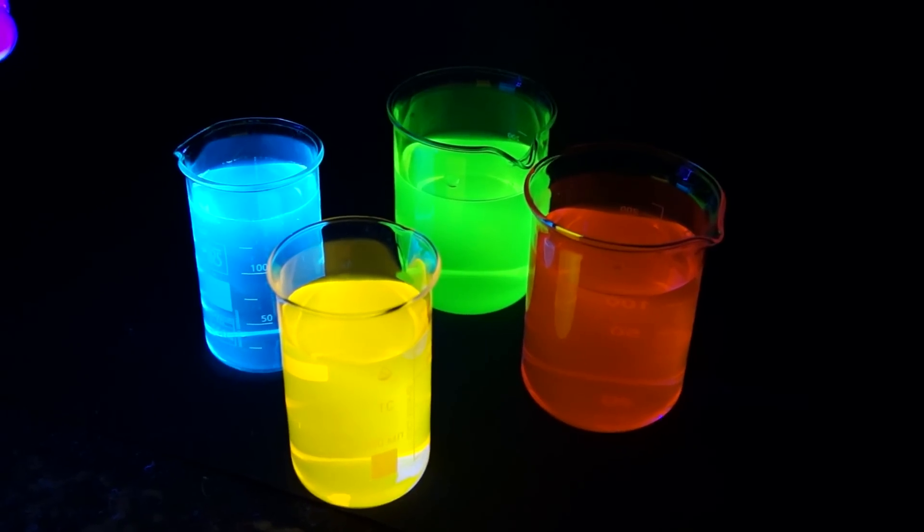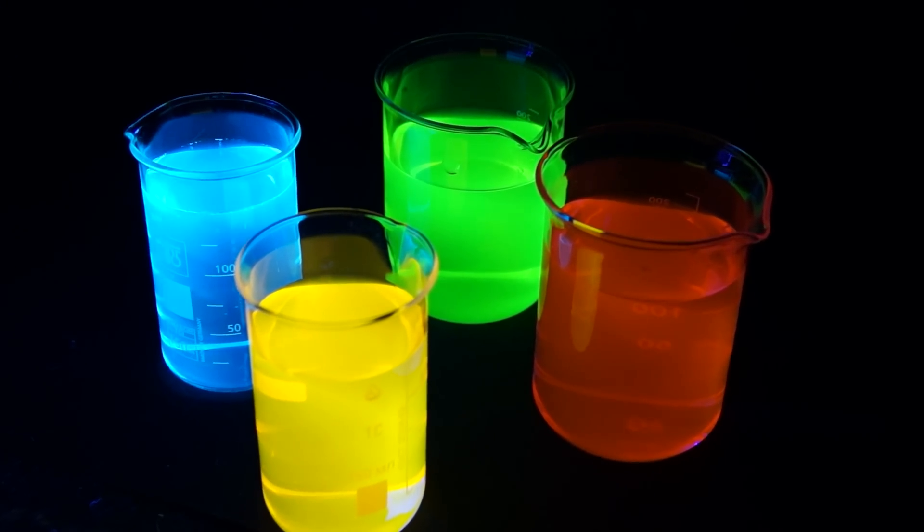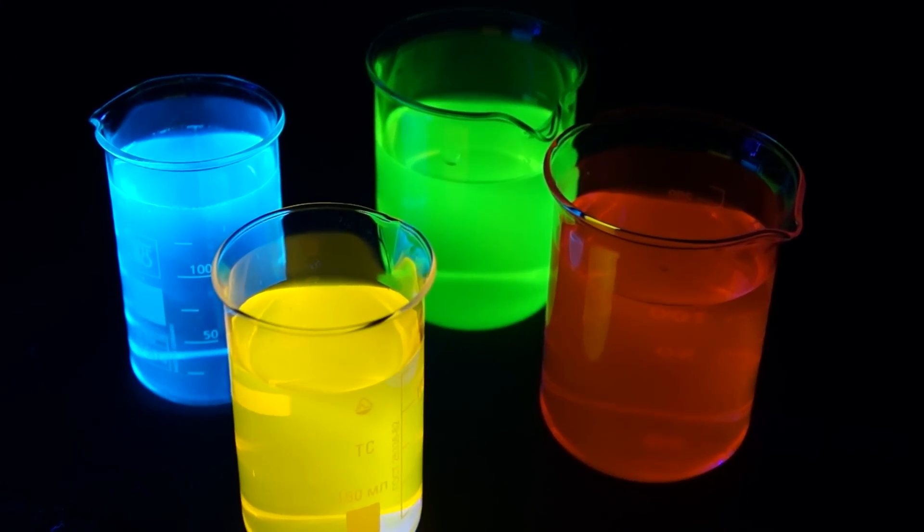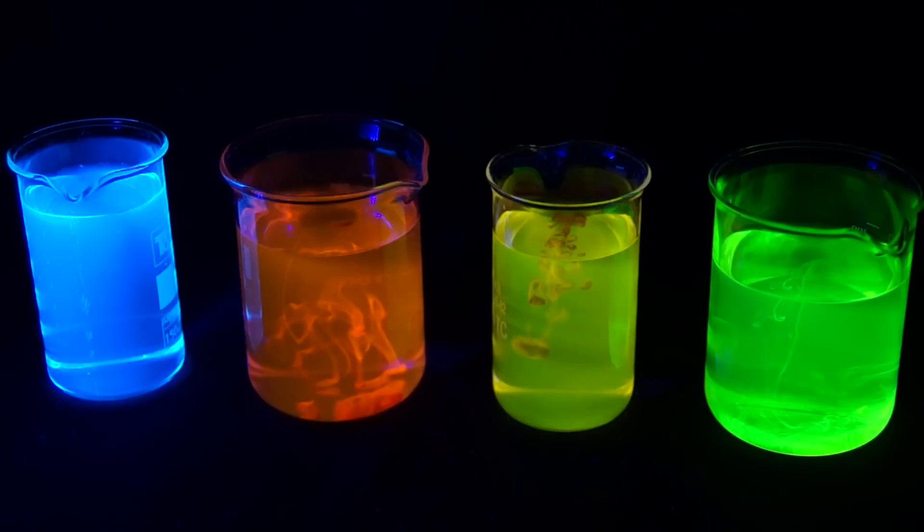Hello everyone! Today we'll conduct experiments with fluorophores, or in other words, fluorescent substances.